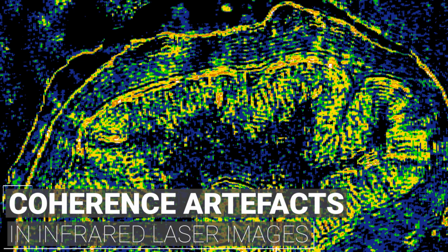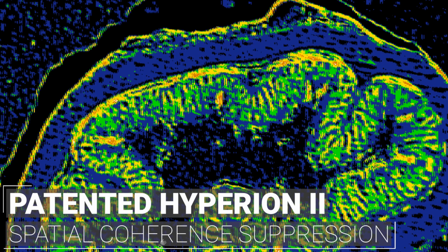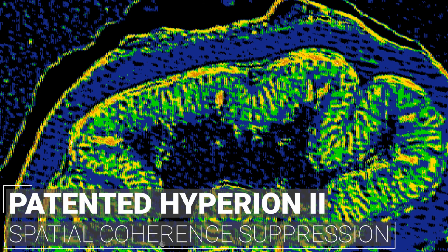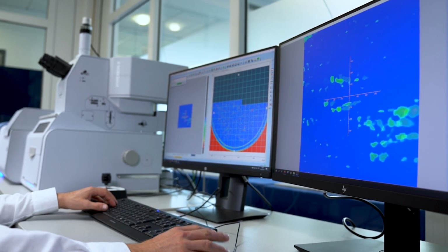So naturally we asked ourselves: is it possible to manipulate photons in a way to reduce spatial coherence? Can we develop an infrared laser system which matches MIR spectroscopy? We wanted a sustainable hardware solution, and simply removing these artifacts digitally in post-processing was no option for us. Through sophisticated optical design we have succeeded in suppressing coherence phenomena significantly without relying on digital post-processing. Our patented coherence reduction technique enables QCL based infrared hyperspectral imaging of unsurpassed spectral quality.